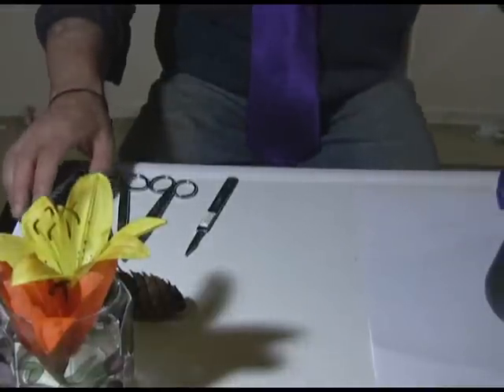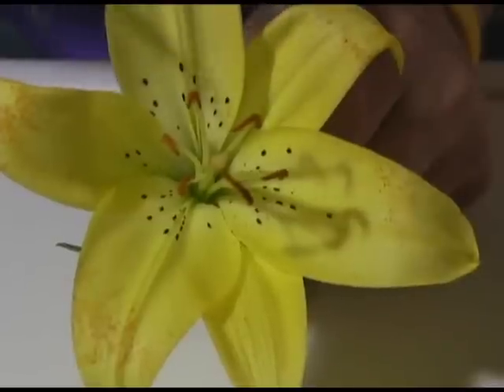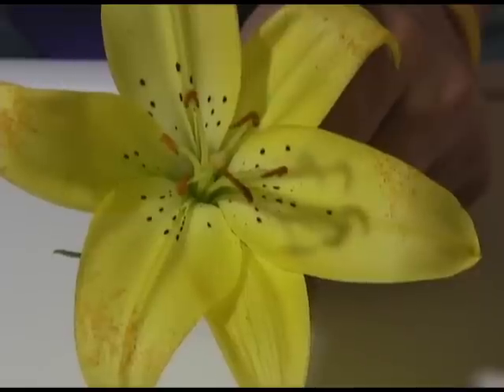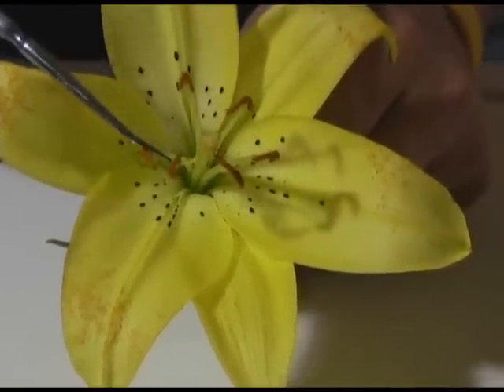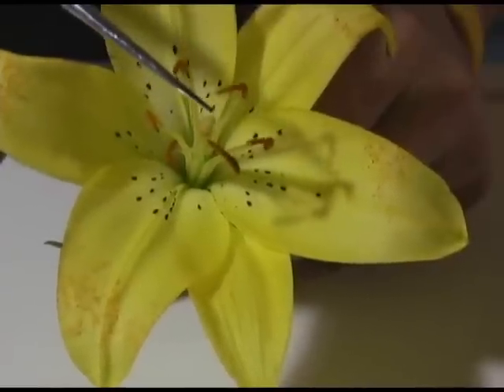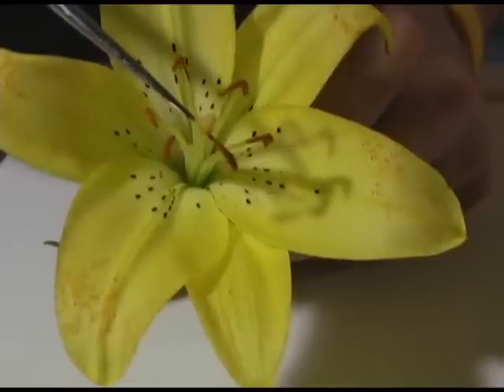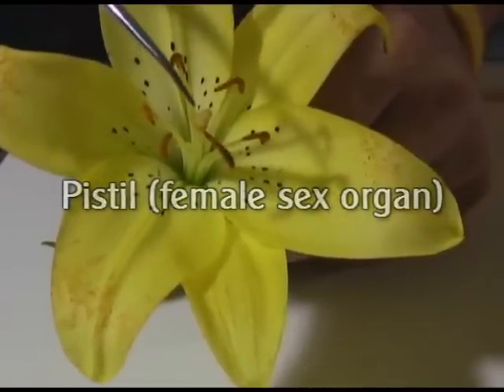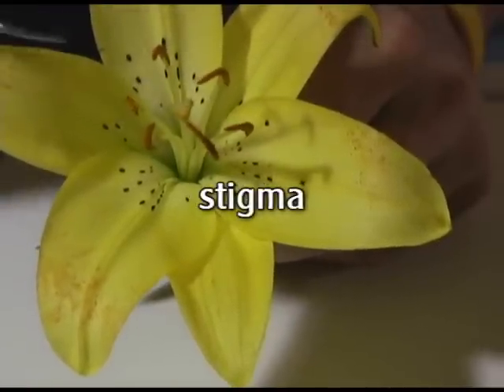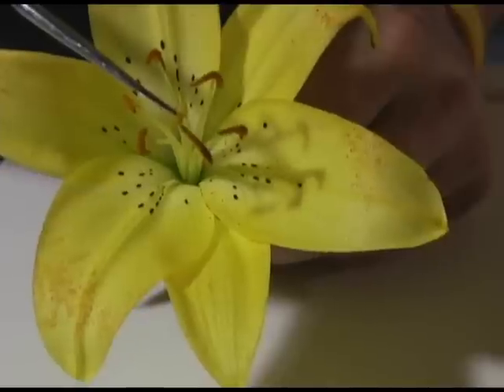All right, so let's get underway with the flower dissection. Here we have the flower, and this is a lily. The flower is the sex organ of the plant. I'm going to point out some of the structures we can see externally, and then we'll take a closer look. As I come in here to the middle, you see a central structure that's sticking up — it looks like a stem. This long thing here is the female part of the plant. This whole thing is called the pistil, and it's made of three parts. The top part here is the stigma, and this is a sticky part where the pollen — which is produced by the anthers — sticks on to the stigma.